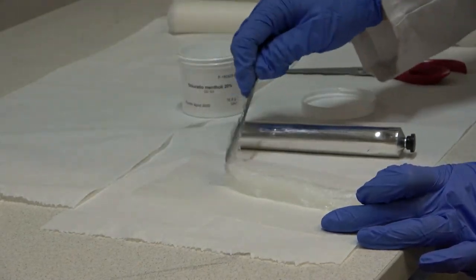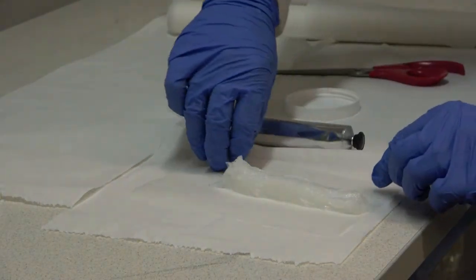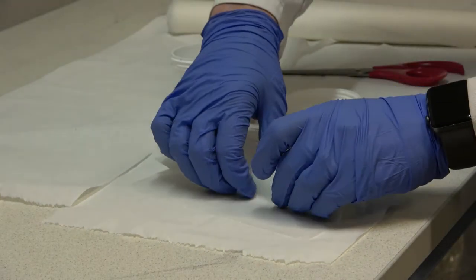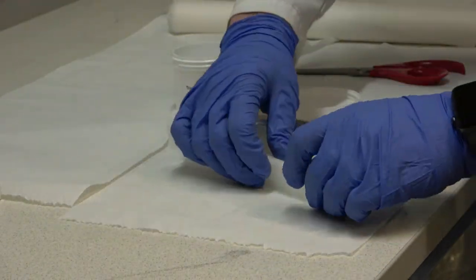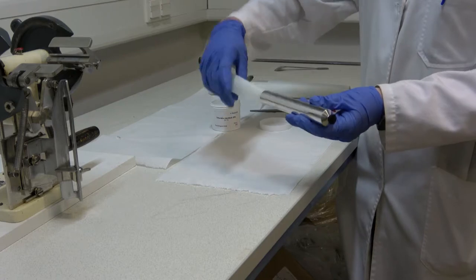The baking paper is rolled up around the formulation and it's slid into the sleeve. Make sure to hold it straight so nothing slides out early, preventing the rest from getting in.